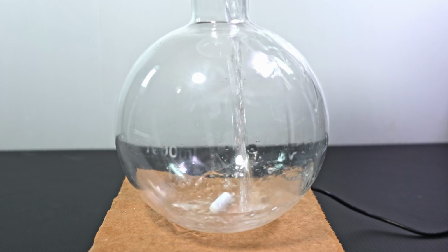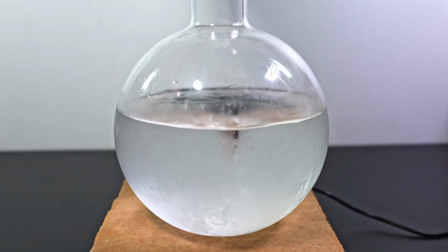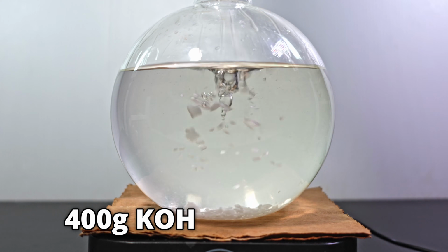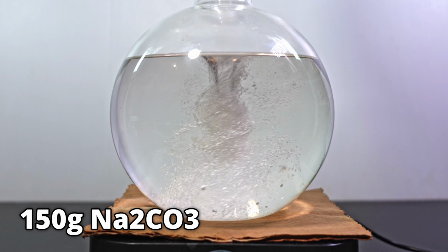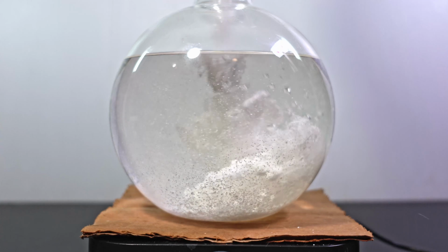First thing I'm going to do is pour in 800 milliliters of ethanol. Next, I'm going to add 400 grams of potassium hydroxide. This is approximately 7.13 moles of potassium hydroxide. Once it all dissolves, I add 150 grams of sodium carbonate. I stir it vigorously so it sops up all the water.